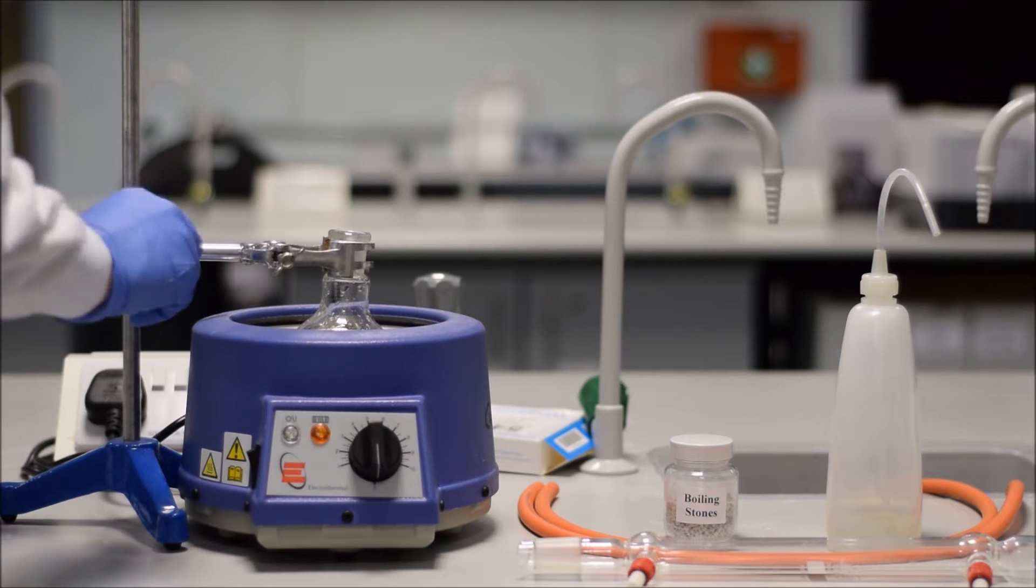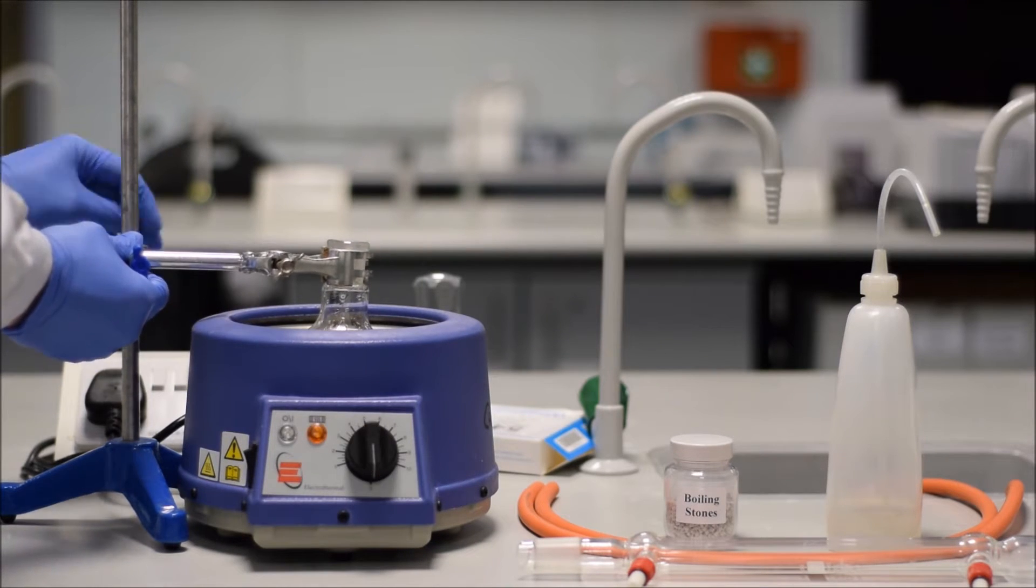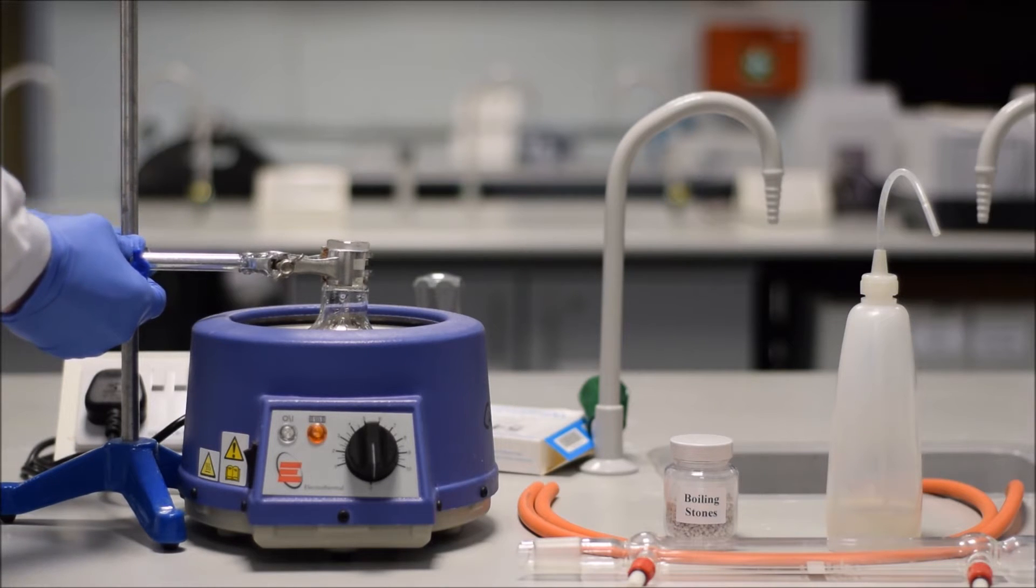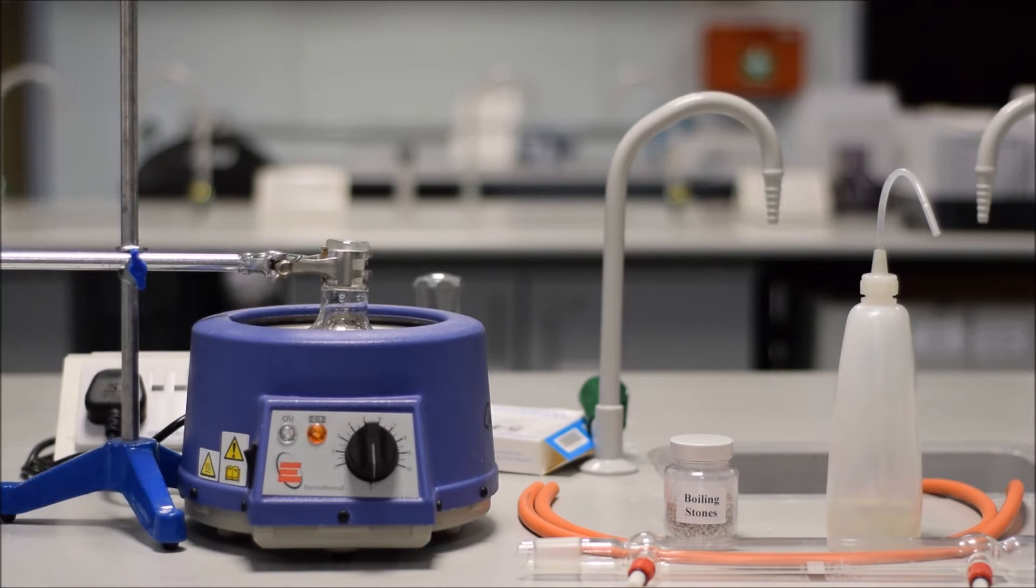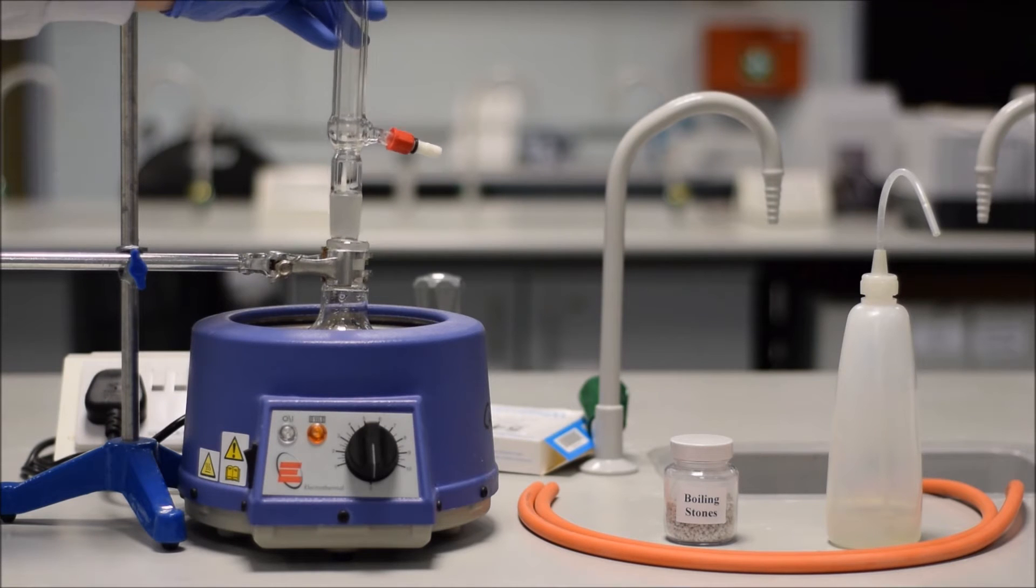First, get it in position, then tighten it so that it's at the right distance from the stand, and then finally tighten it so that it's at the right height on the stand. And by following that, you're not going to have excess strain on your glassware. And it's important not to strain your glassware, because if you do, it'll eventually crack or it'll fall.